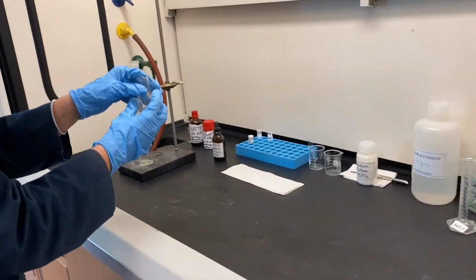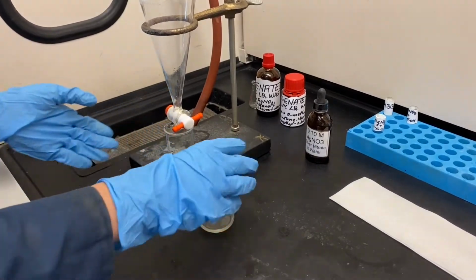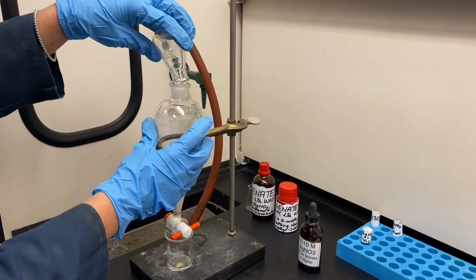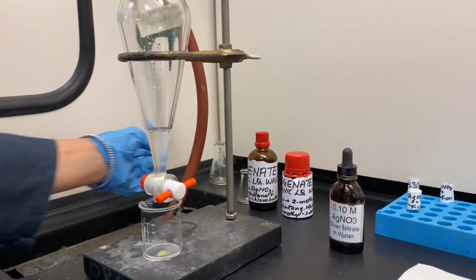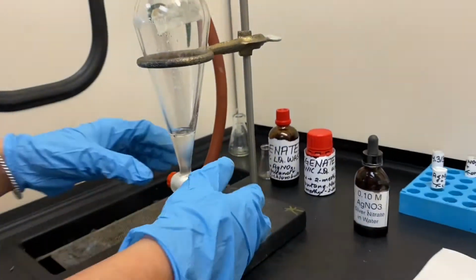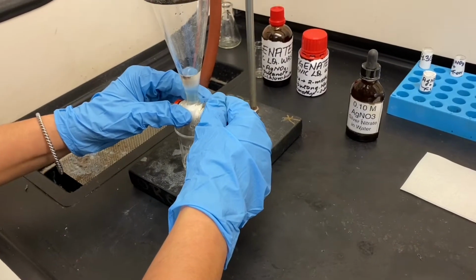We will now pour this mixture in the separatory funnel. Make sure your separatory funnel is closed and has a beaker or any other apparatus under it to catch the contents. After I have poured all the mixture from the flask, I will see 2 separate distinct layers. The bottom layer is the aqueous layer while the top layer is the organic layer. See your manual notes to find which is which.